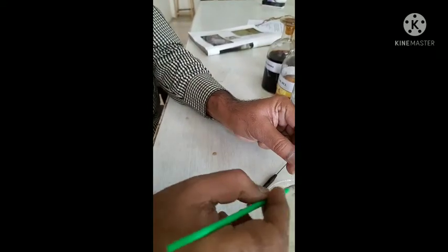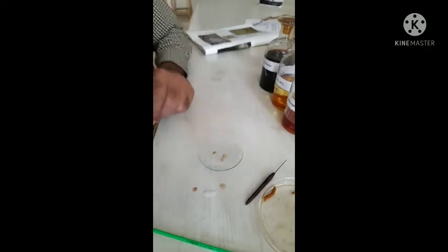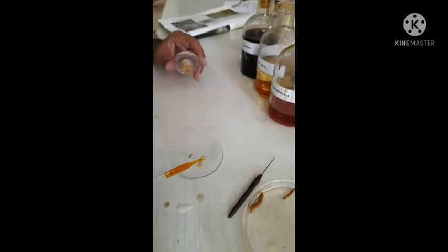After 5 minutes, remove the bleaching reagent from the watch glass. The bleaching reagent reduces the pigmentation from the section, making the section clear in appearance. After the bleaching reagent, we directly apply the staining reagent.